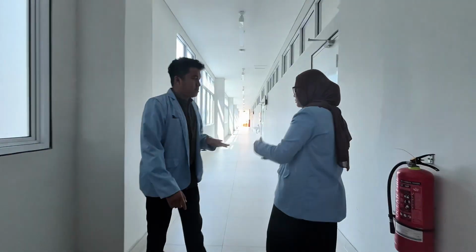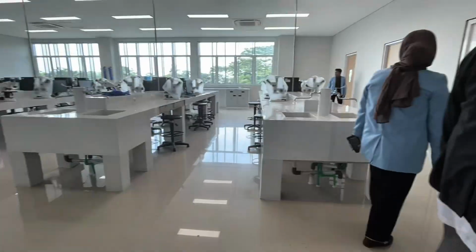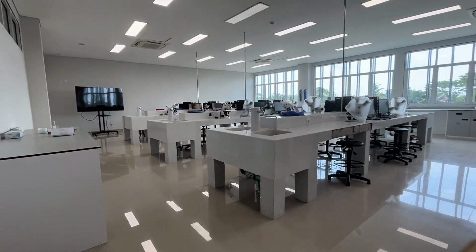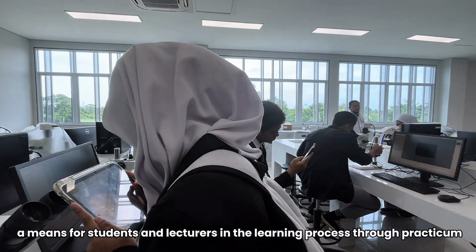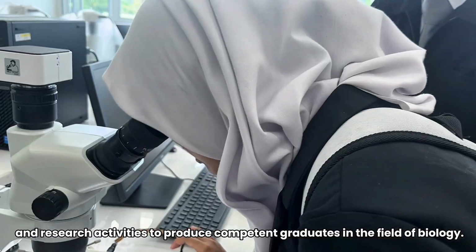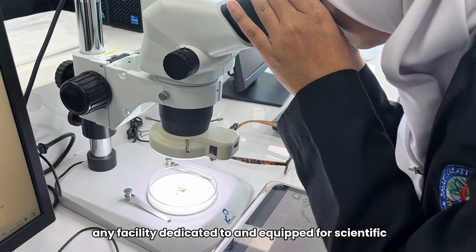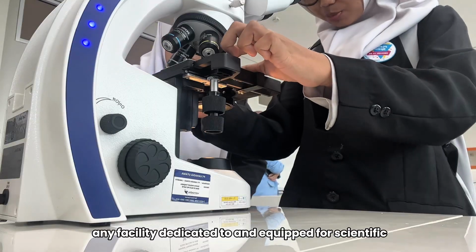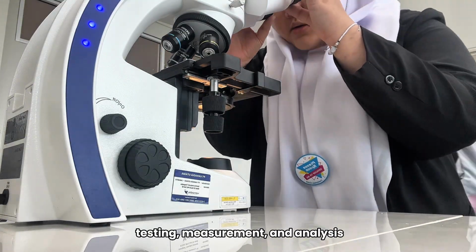Now, let's go to the basic biology laboratory. This laboratory is meant for students and lecturers in the learning process through practicum and research activities to produce competent graduates in the field of biology. It is a facility dedicated to and equipped for scientific testing, measurement, and analysis.